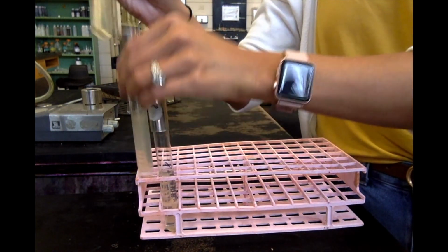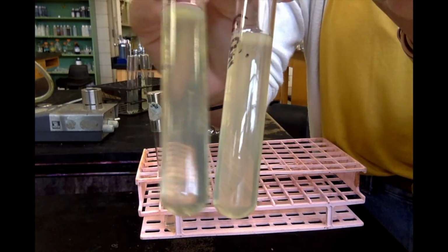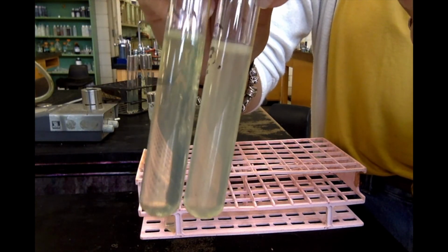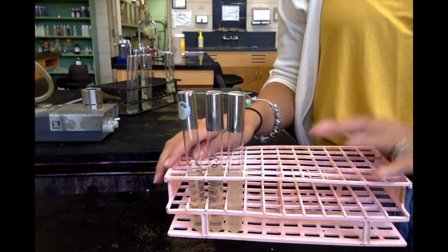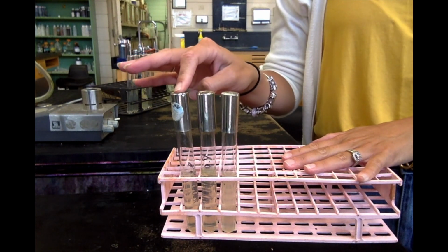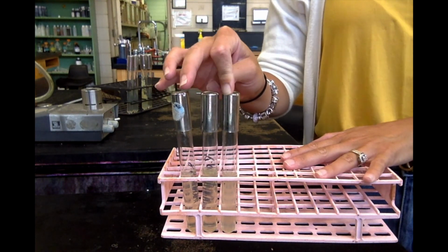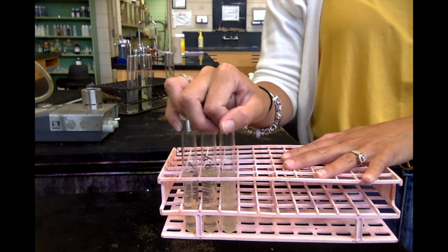Compare it to E. coli. You see how clear the bottom of this tube is and how cloudy this one is. So there's no growth at the bottom of this tube, meaning that this organism is a strict aerobe. So those are my 3 potential results for the motility stab. I've got a facultative and non-motile organism, an aerobic motile organism, and then a facultative motile organism. And those are the three potential results that you could get whenever you're doing a motility stab.